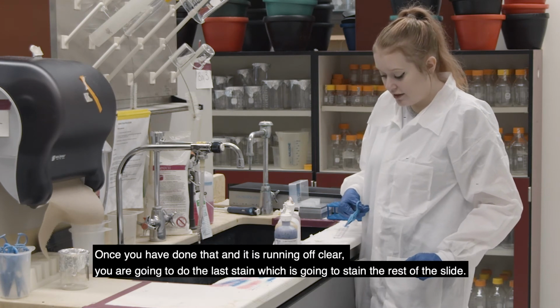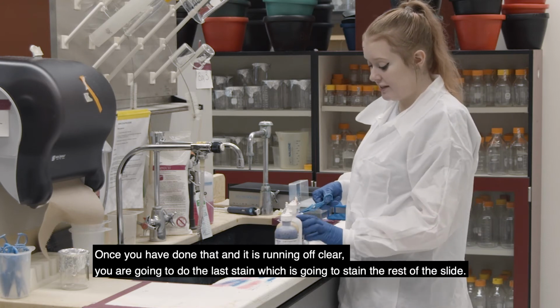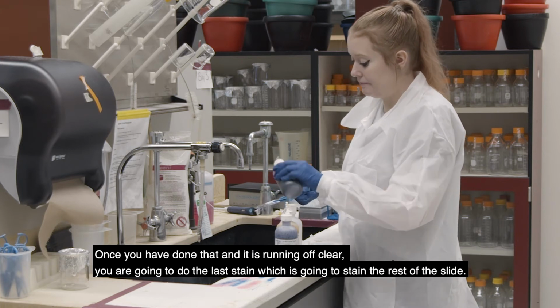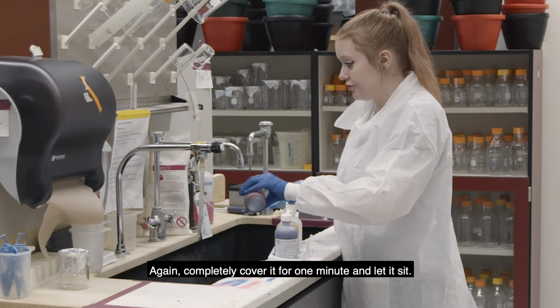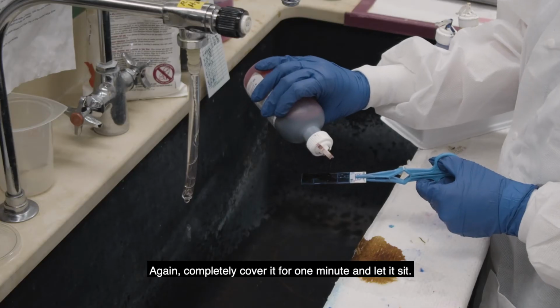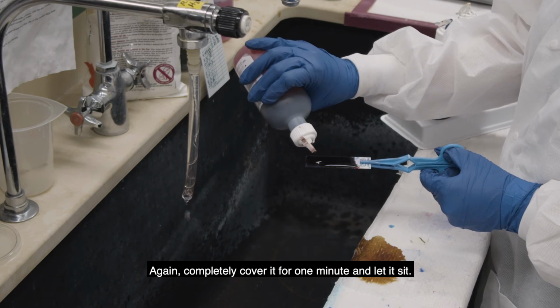Alright, so then once you've done that and it's running off clear, you're going to do the last counter stain, which is going to stain the rest of the slide. So you want to, again, completely cover it for 1 minute, and then let it sit.